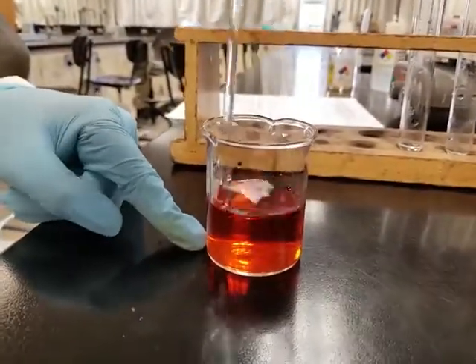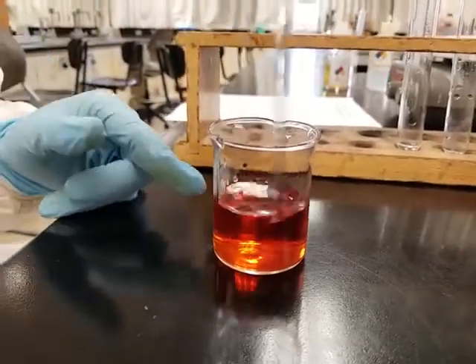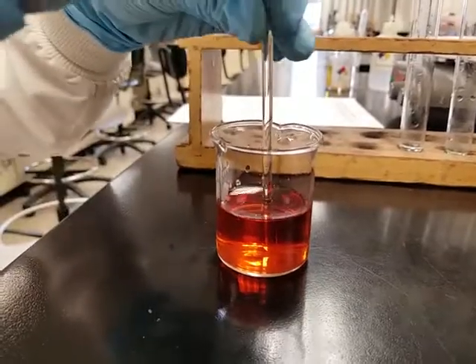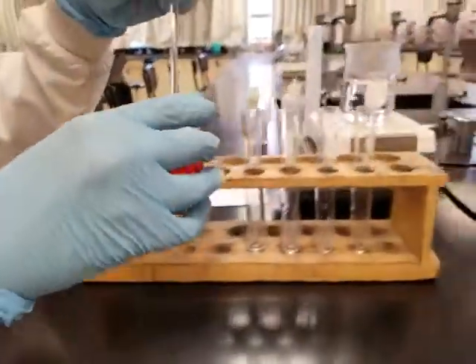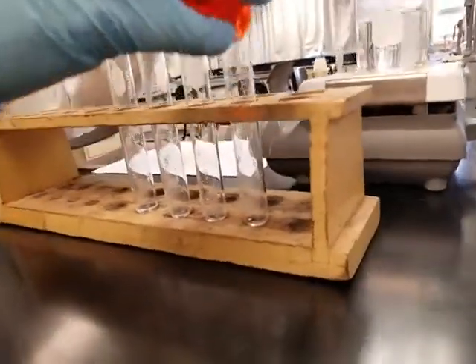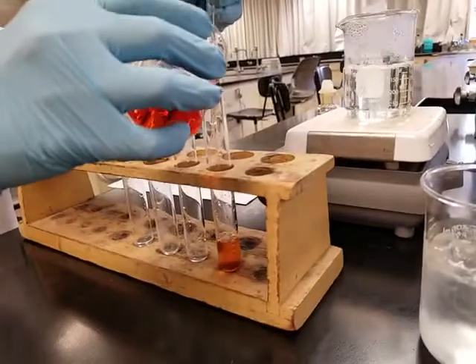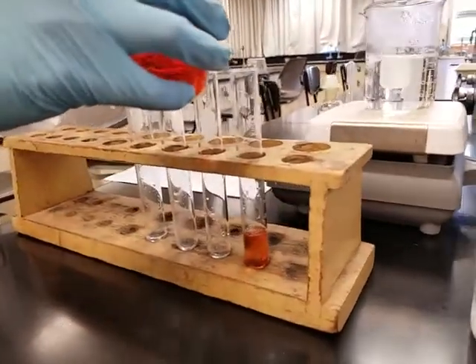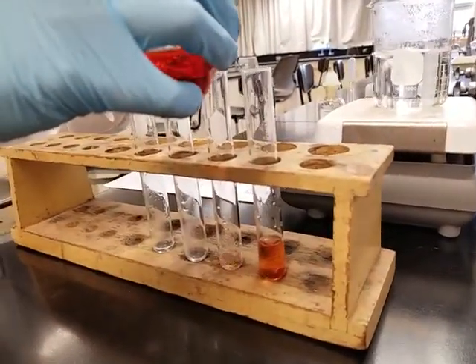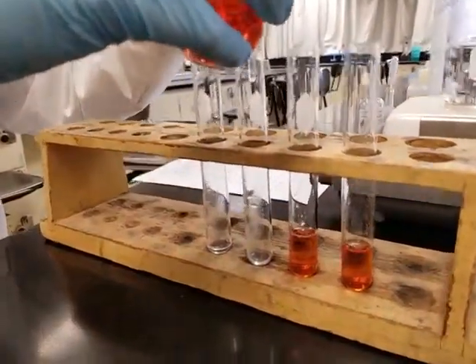We're going to be performing basically 3 reactions on this solution, so it's a good idea to have a stock solution and to evenly distribute it to these different test tubes. All right, so let's go ahead and distribute about 10 mL each. I'm just going to eyeball it. As long as I have similar amounts, that'll be fine. So let's go ahead and do that.